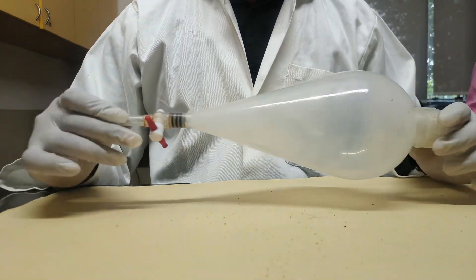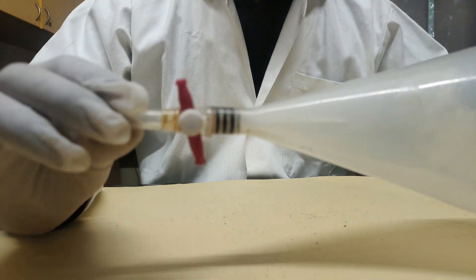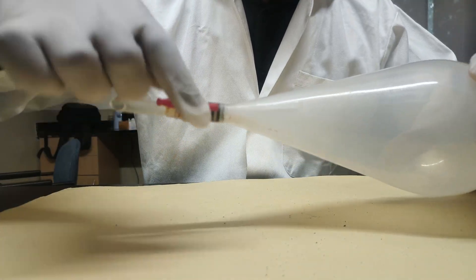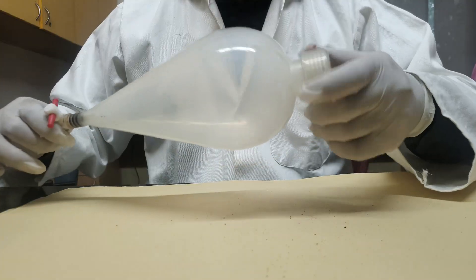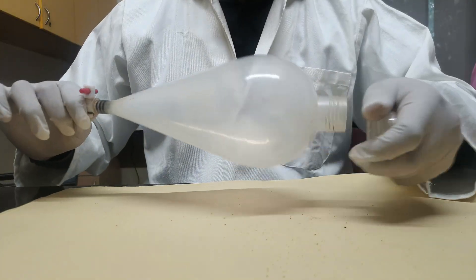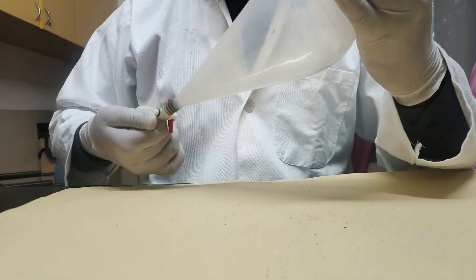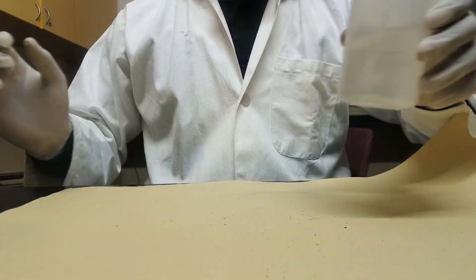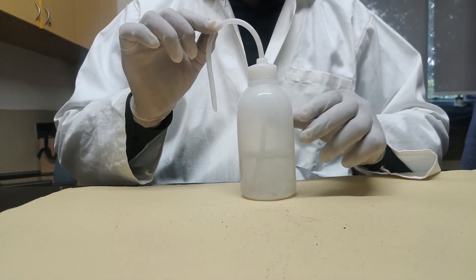Next item is the separating funnel. It is used to separate two immiscible liquids. It contains a valve on the bottom side — you can open it perpendicular and close it again. It is used to separate liquids like oil and water; by opening from the top we pour the chemical inside and then separate the two immiscible liquids.